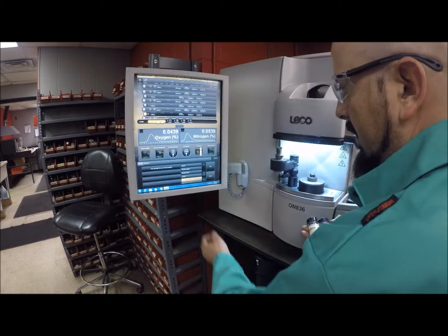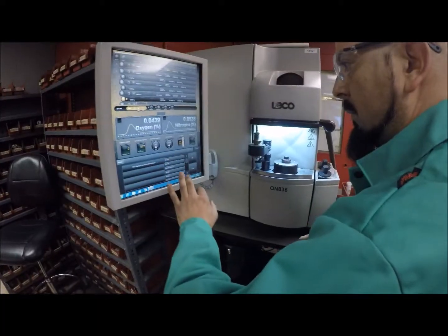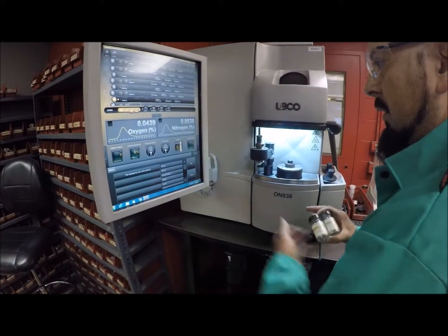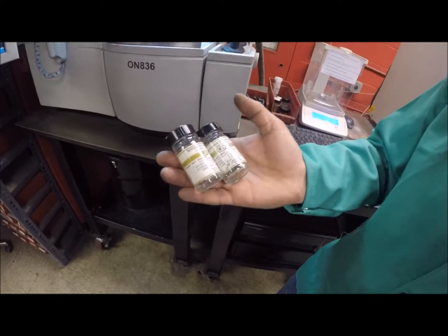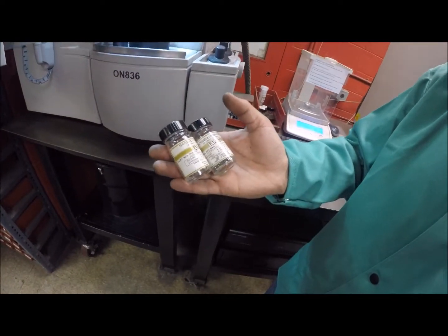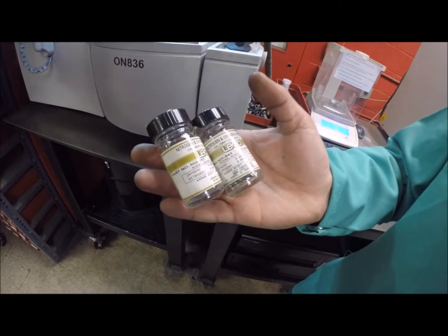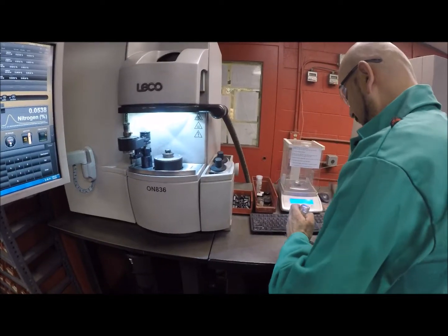The LECO nitrogen analyzer utilizes impulse resistance heating in a helium stream to release nitrogen from samples. This nitrogen is then quantified by the analyzer cells. The video demonstrates one of our lab technicians utilizing the instrument.